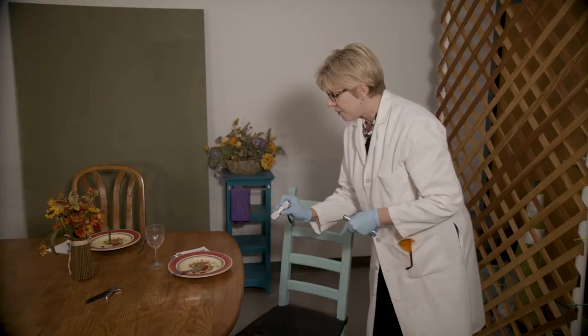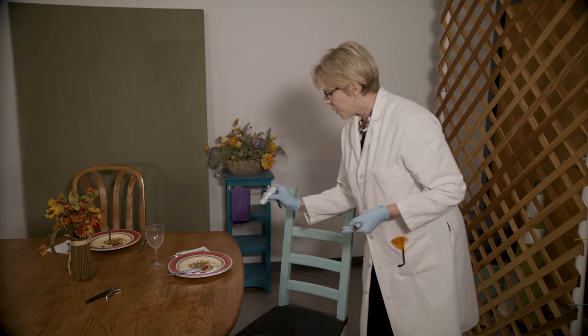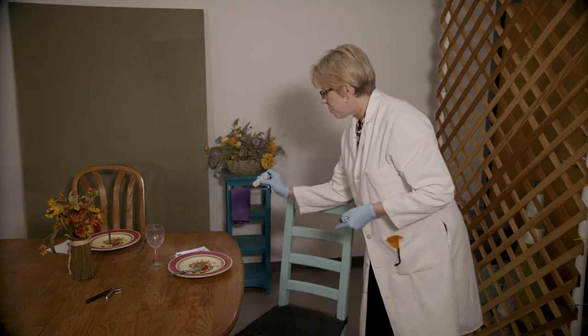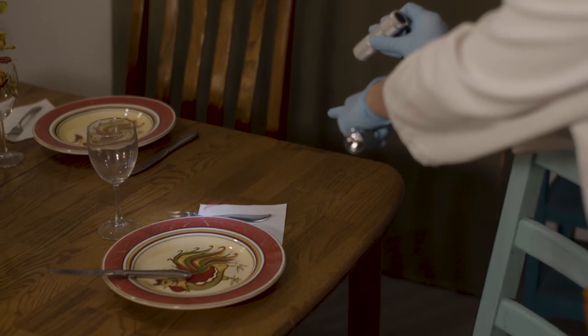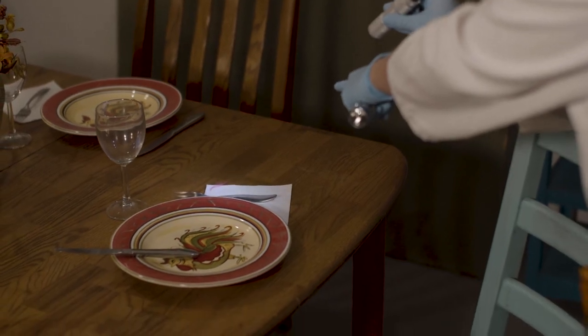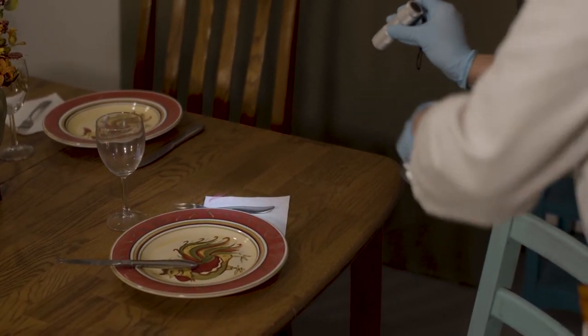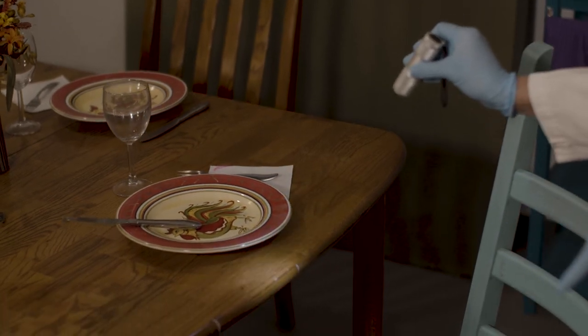The flashlight can also be used to look at other pieces of evidence which could be of interest. Look — there is a piece of trace evidence, this pink fiber. Let's take a look more and see what else we can find. And here's another piece of pink fiber.